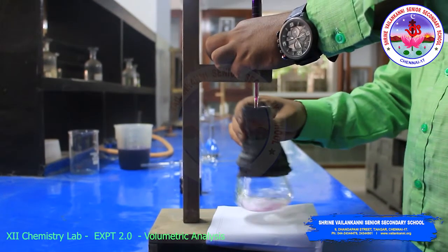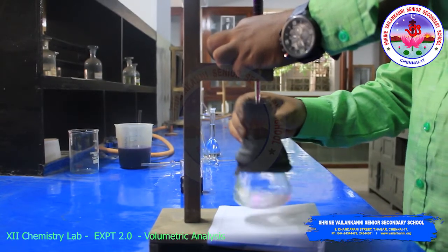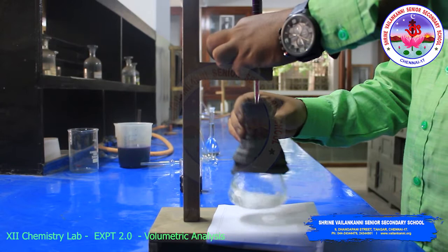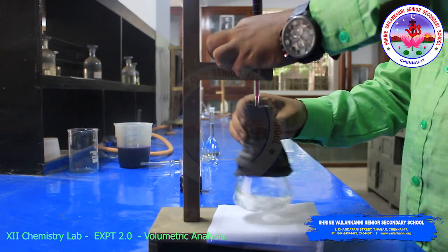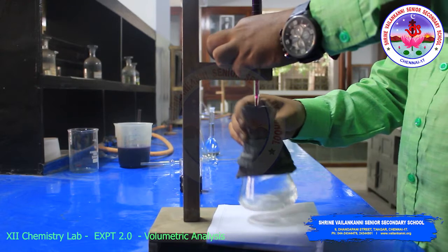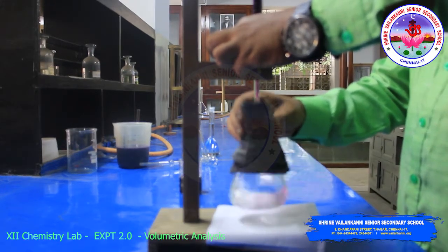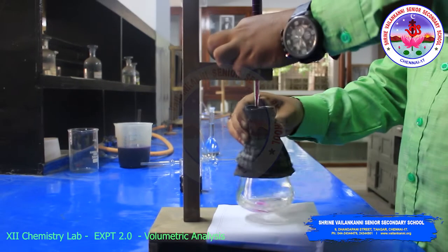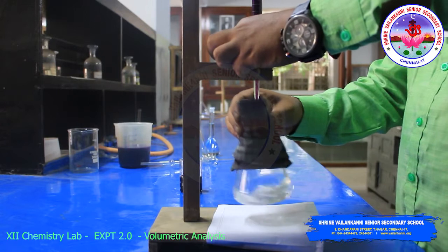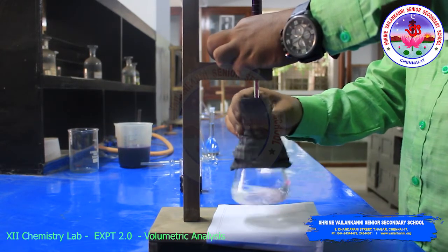Once it reacts with potassium permanganate, it shows pink color, but immediately disappears. So you have to stir well. Slowly add drop by drop. The conical flask is hot, so you use any waste cloth.